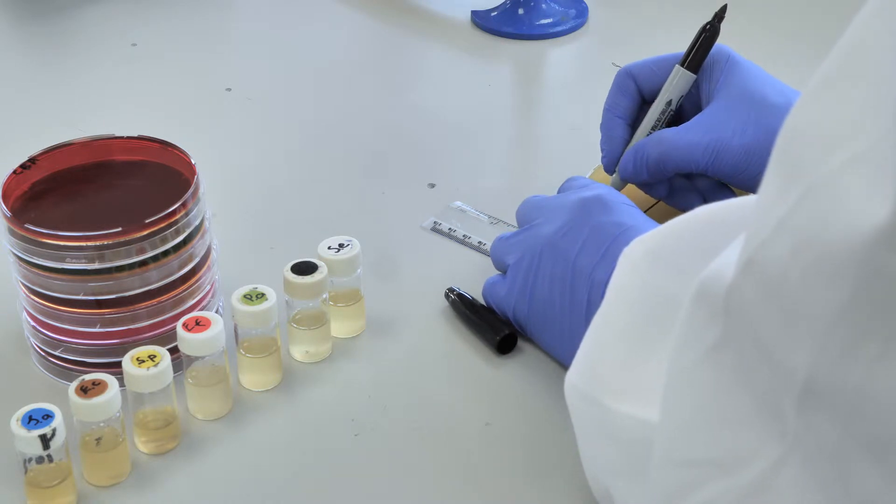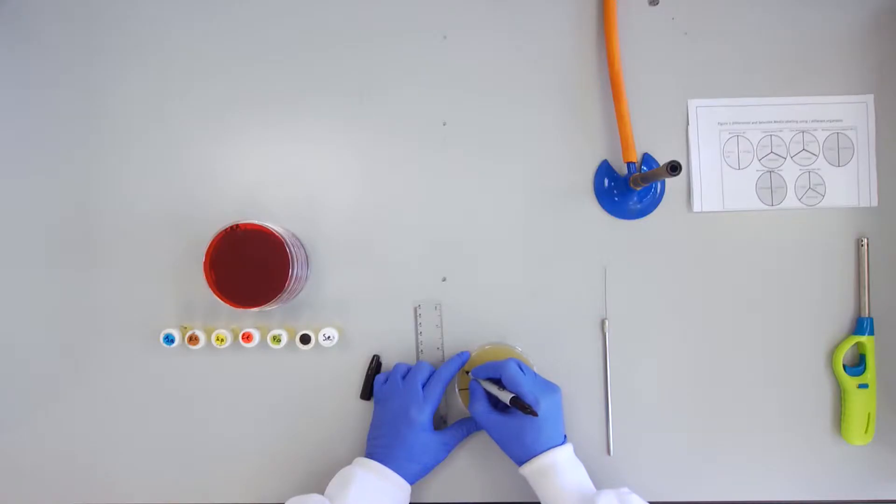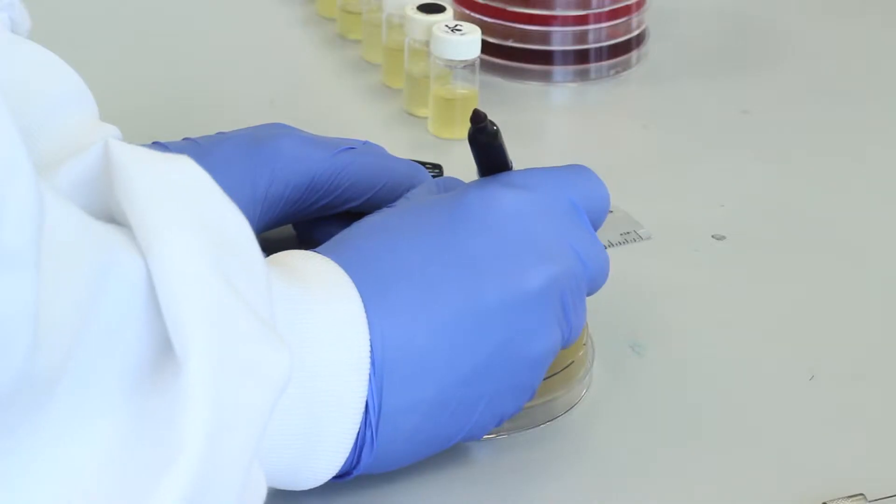This is particularly important as a large number of cultures are in use and cross-contamination will obscure results. Begin by labeling each of the six plates provided.